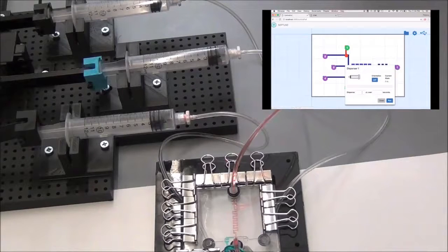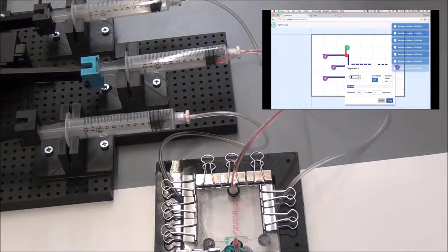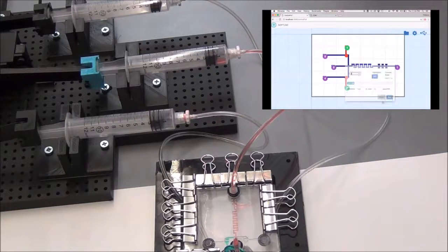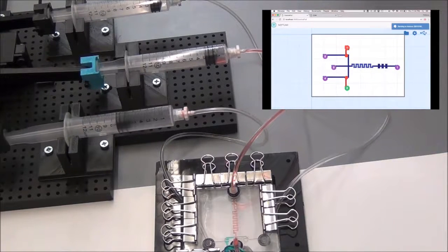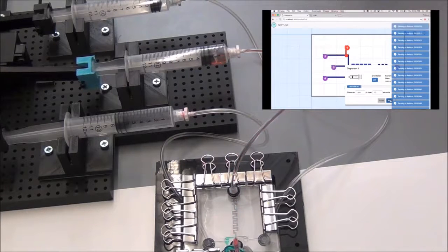As a reminder, his goal is to characterize the expression of a novel genetic part when variable levels of inducer are present. First, Dr. Ali sends through cells mixed with culture to trap the cells in his microfluidic chip. After this, he opens up the first valve, which is controlling the inducer's ability to enter the chip. Second, he flows a blue inducer over trapped cells to induce expression. He then clicks on the first valve again, closing it and cutting off the inducer from the trapped cells in his system.